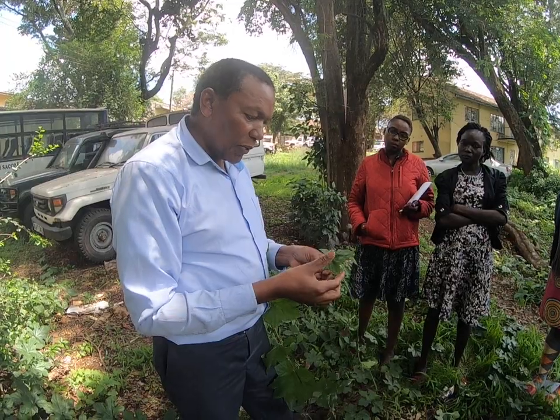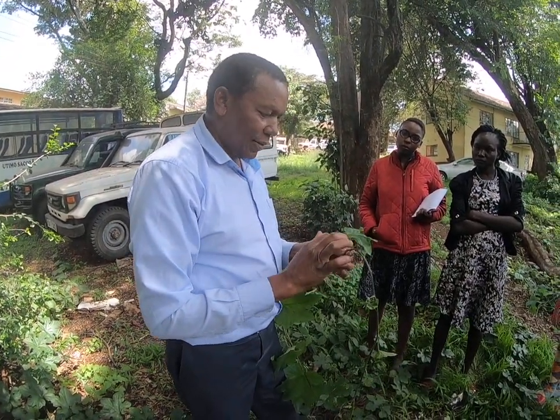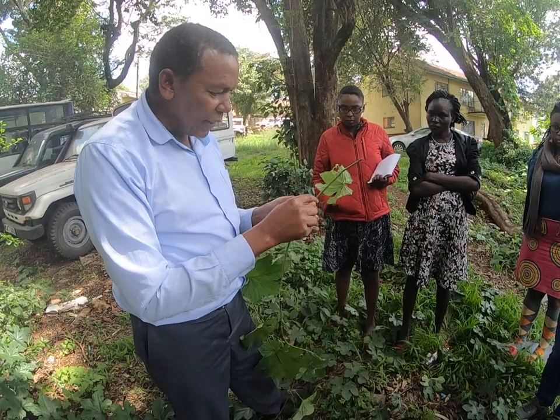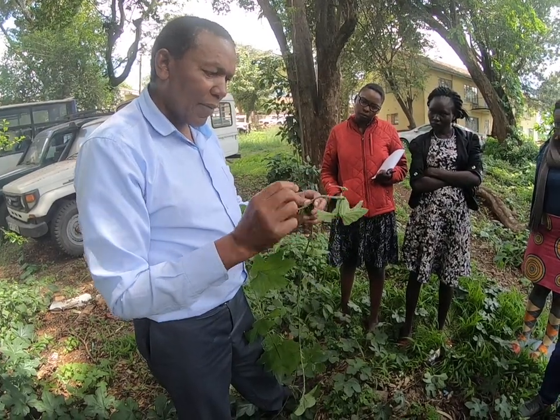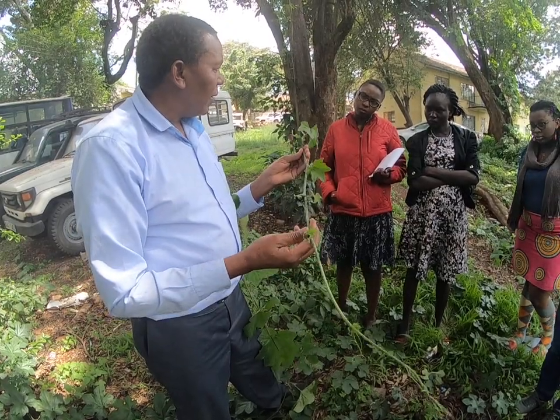The taxonomist will also look at the shape of the leaves. You see there, we call them lobed. They are lobed. Okay? The taxonomist will look at the shape of the plant. If you cut this, you'll see it is ribbed. Iko na ribs. Sawa? Iko na nodes. These are all things which will help the taxonomist.